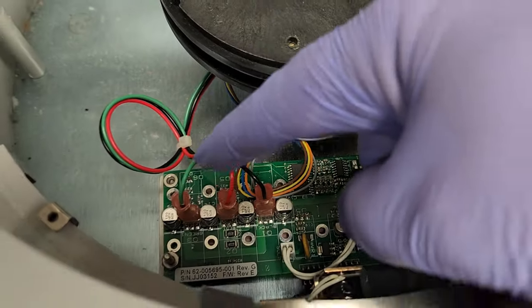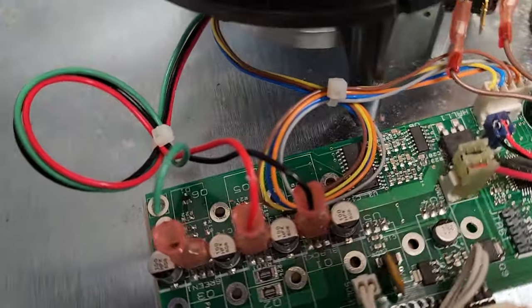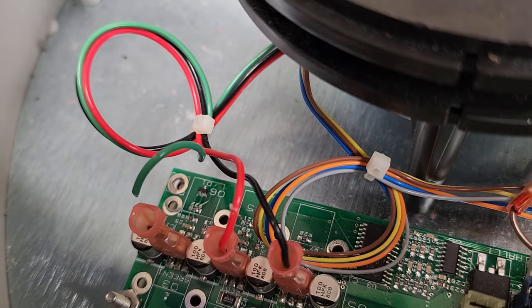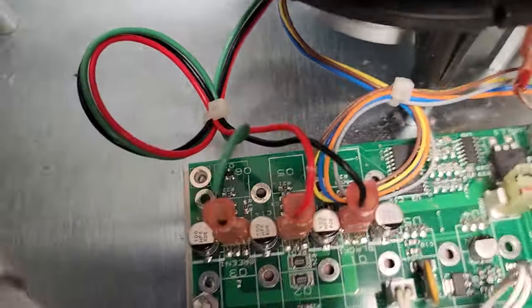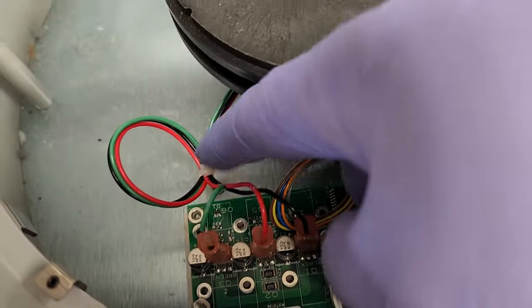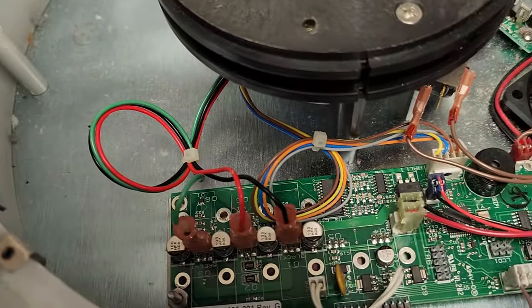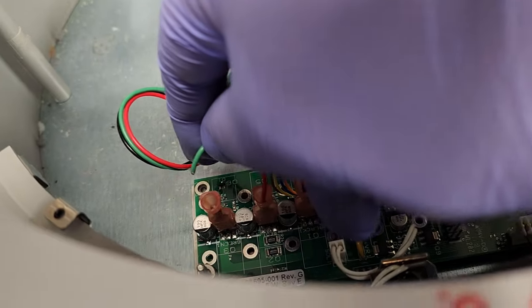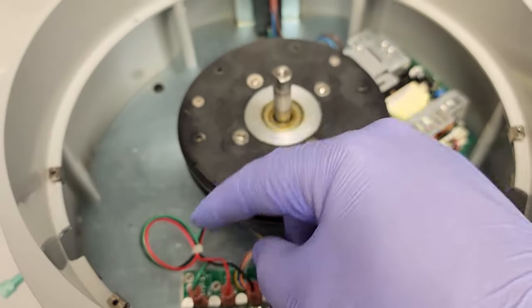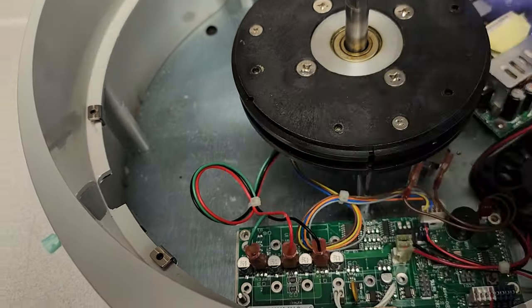I disconnected my first terminal — the green one — went to lift it up, and look what I found. You see it? It was barely holding on to the outer insulation. I checked the other ones to be sure; it's not that they were rubbing on anything — it's just maybe a poor crimp from the factory that crushed the conductors a bit too much. Over time, copper when it's bent back and forth work-hardens, and you will get a snap — just like that.